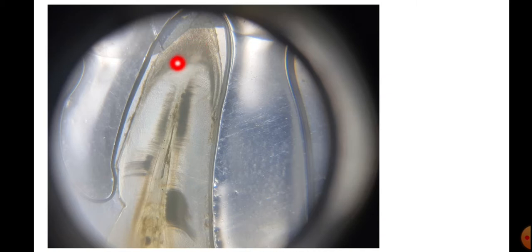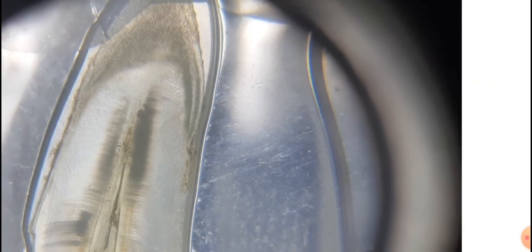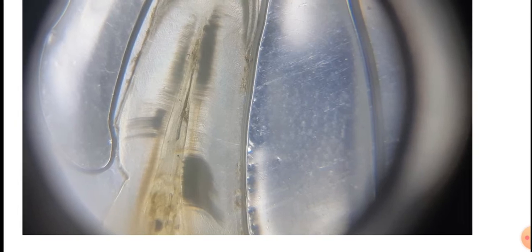Here in the enamel, the rod shaped cells present there are the prism cells. These are present in a specific manner, which you can find out here. These are called the lines of Retzius. Now here these are the dentine tubules. The dentine tubules run parallel with each other from the pulp cavity towards the enamel in the crown. Here this is the dentine material.